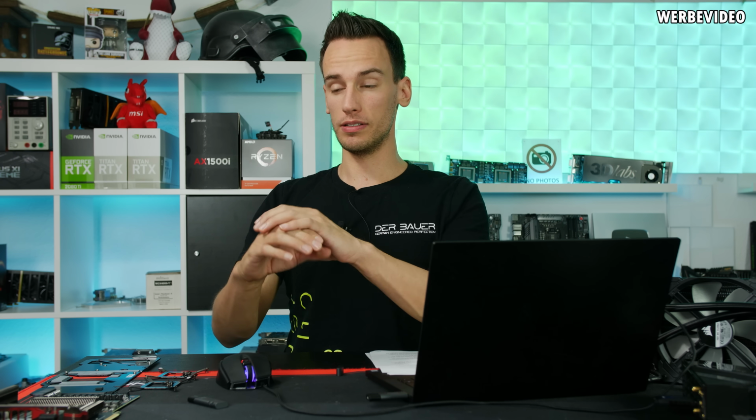Before we check out the Tescan footage step by step, how we took apart the CPU and took the shots of the 14 and 7 nanometer transistor, a quick look at how a transistor nowadays looks like, because this will be important so you can also understand the images we're getting from the Tescan microscopes.